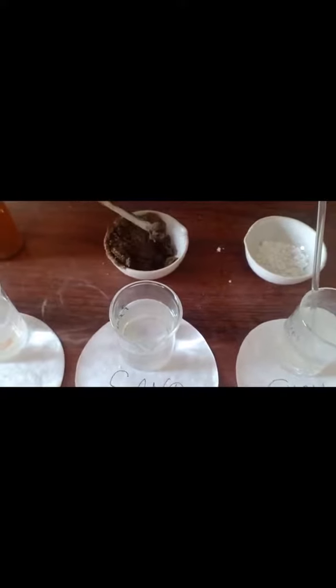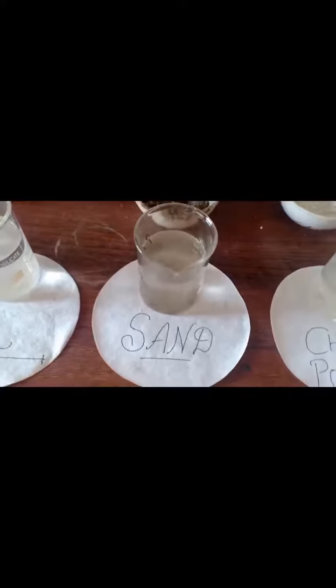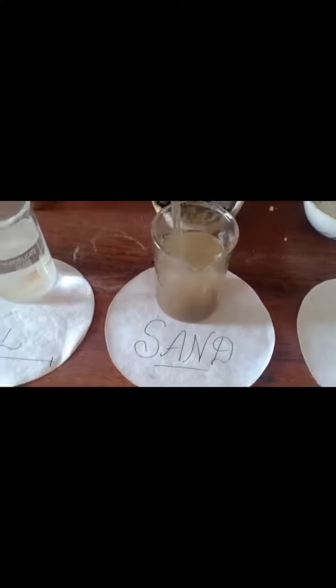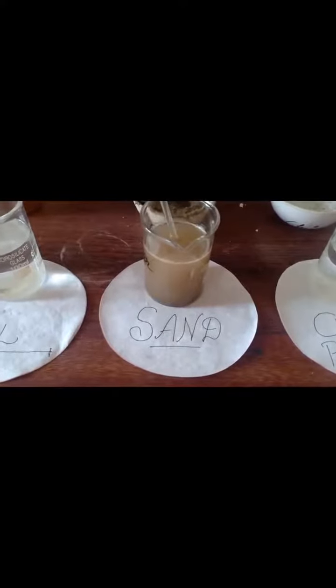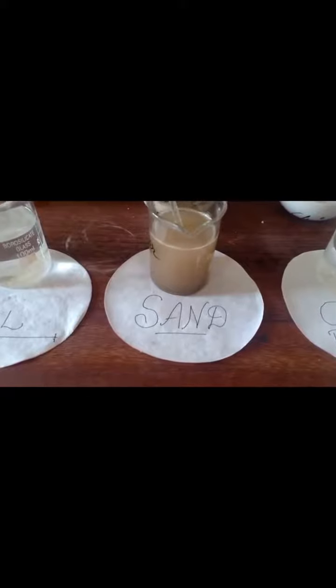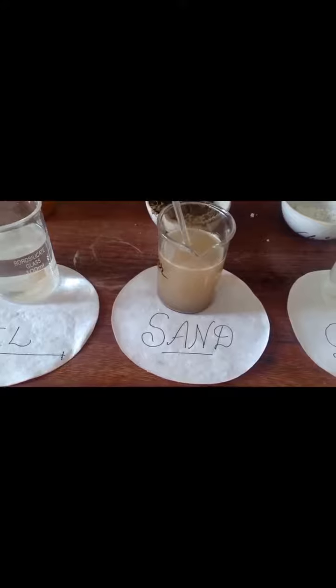Now I mix a sand particle into the water and mix it with a stirrer. We can observe that after some time the sand particles are settled down at the bottom of the beaker but they cannot dissolve completely into the water.